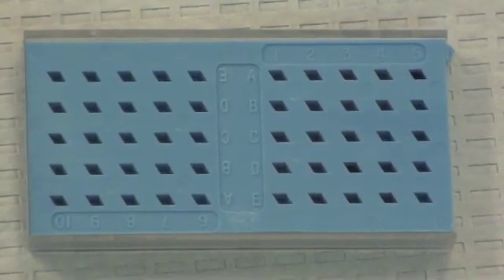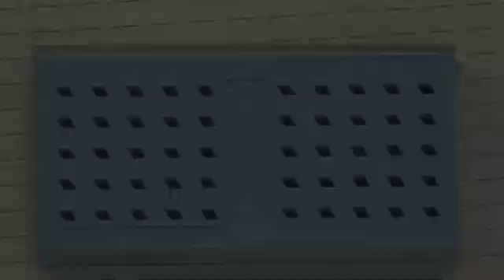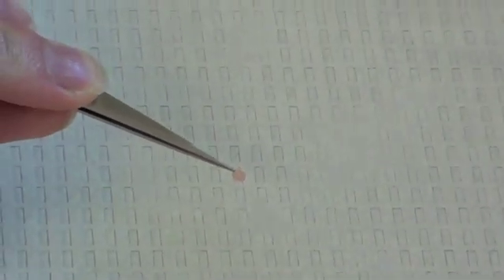The grids used on the TEM are stored in little blue boxes such as this. Here's what the grid looks like. We'll be using the dark side, shown here. This is where the sample will be prepared.